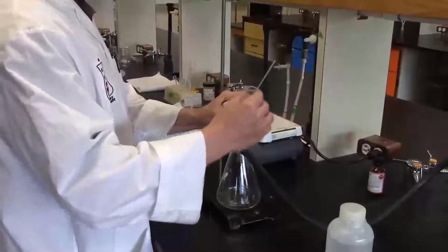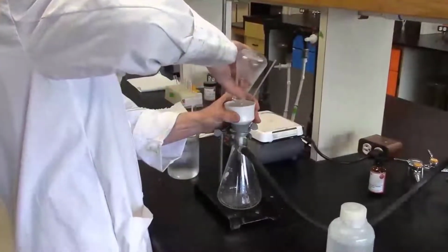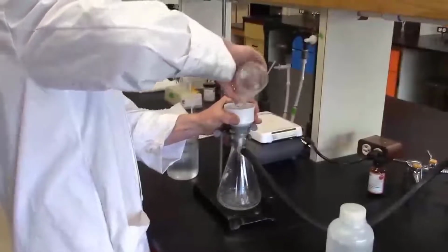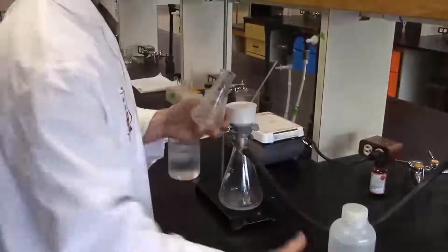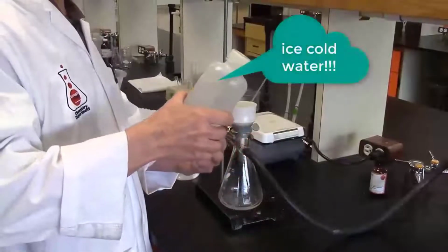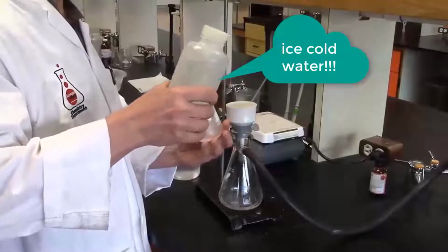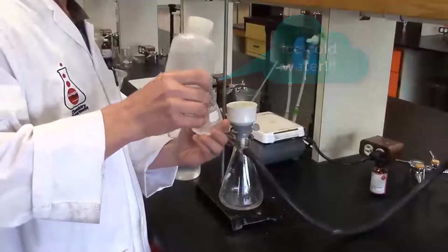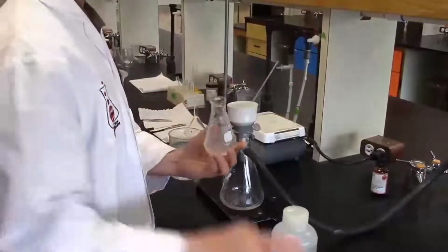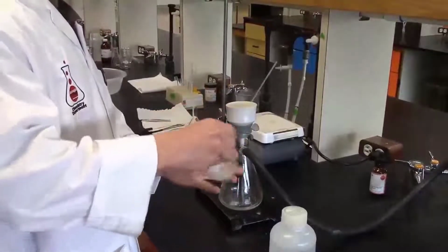I'm going to transfer fairly aggressively. So you want to get, of course, as much solid over as possible. Of course, there are some crystals remaining in the Erlenmeyer. So I'm going to squirt in, and I'm guesstimating maybe on the order of about 5 to 10 mils. Just a couple of small washes.